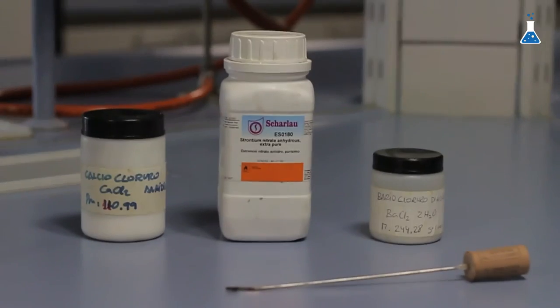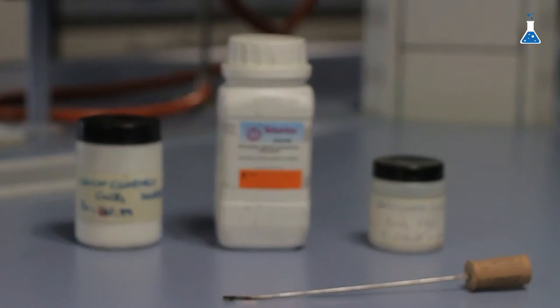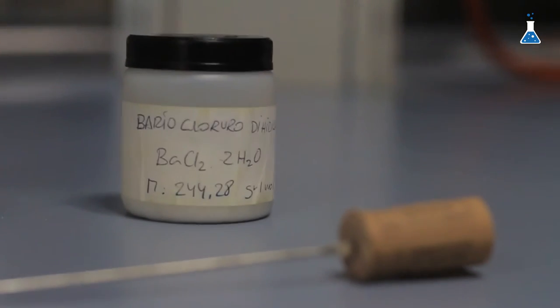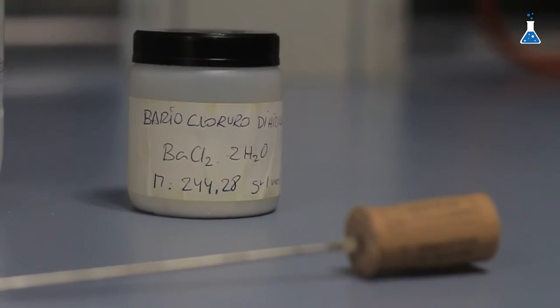We are going to visualize these colors on a small scale through the colors emitted when compounds containing the metal ion are heated in the flame. We are going to use a spatula pinned to a piece of cork, and we will rinse it in water between each experiment in order to avoid any contamination.